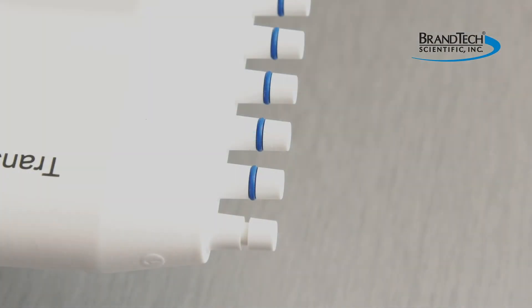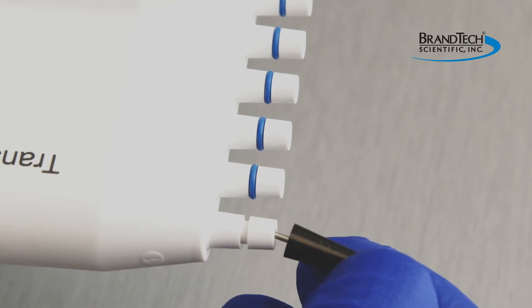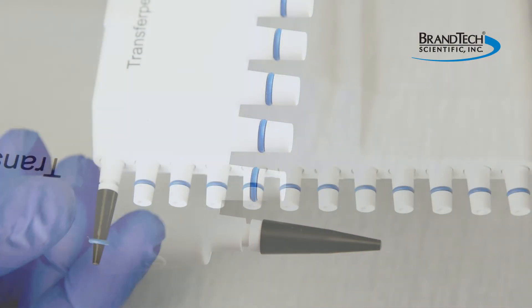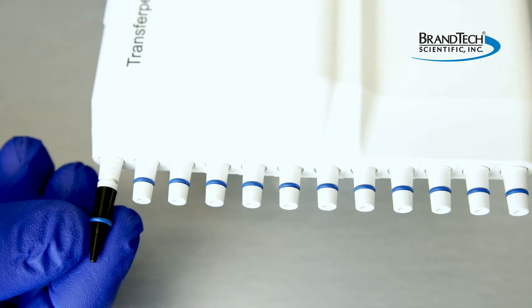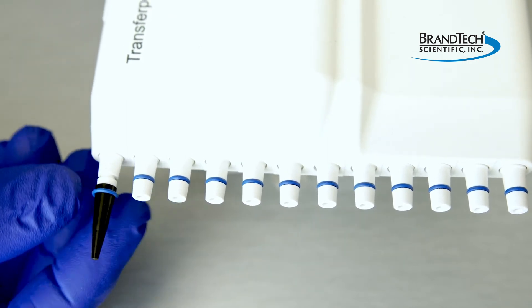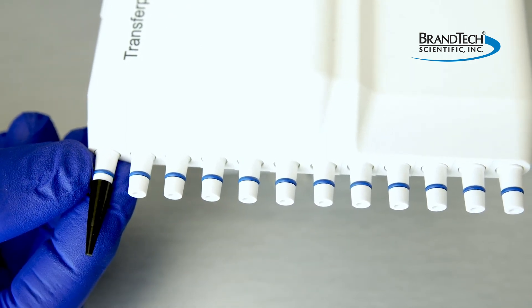Larger volume instruments with O-rings may have an additional tool to assist in mounting the rings. Insert the metal pin into the end of the tip cone. Sliding the replacement ring down, the tool will assist in stretching the ring as you slide it into place onto the tip cone.